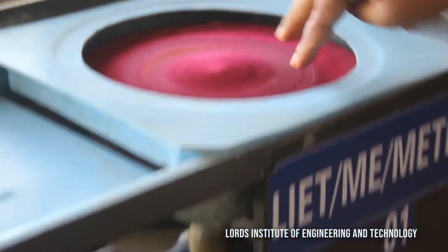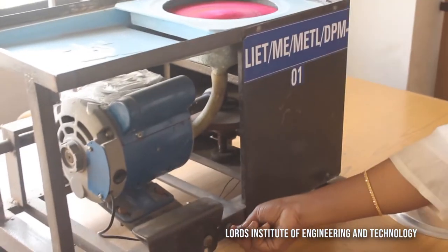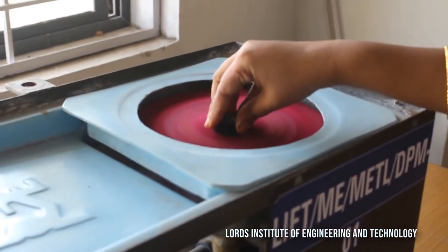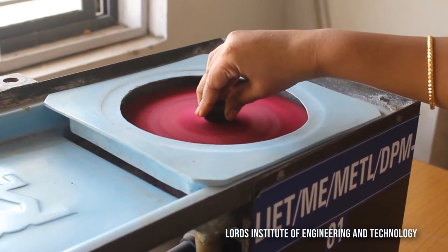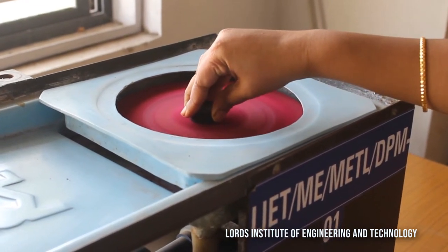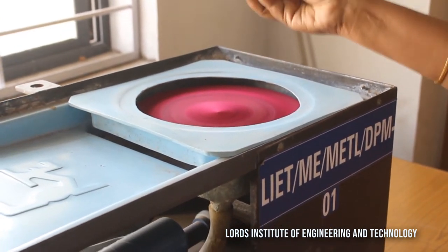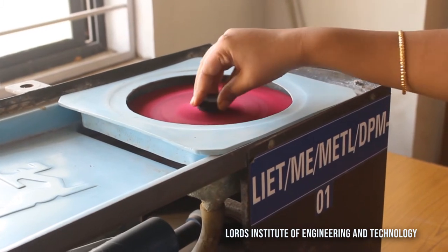The polishing machine has a motor for power supply, and a velvet cloth is placed on the polishing disc. Start the machine, hold the specimen tightly and place it against the polishing disc where polishing is done. Hold it for two to three minutes to get the fine structure. If you feel uncomfortable, you can remove it gently and replace it — do not hold it for too long or it will reflect back.